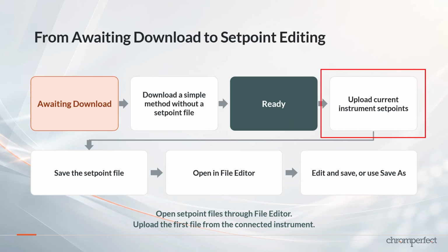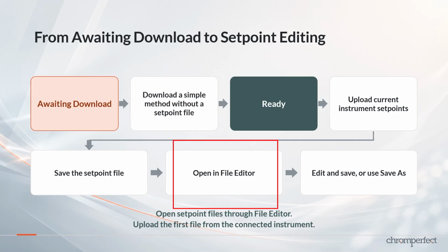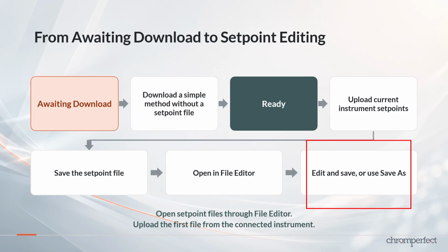Upload the current set points from the instrument. Save the uploaded setpoint file. Open the uploaded file in File Editor. Edit the setpoint file if needed. Then, save the file or use Save As to create a new version.